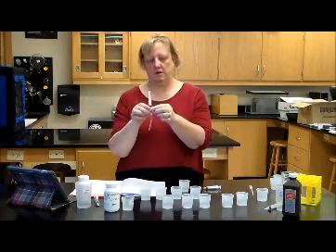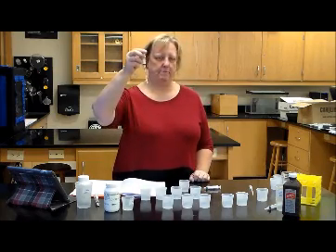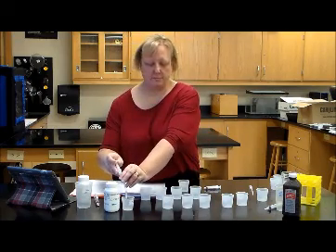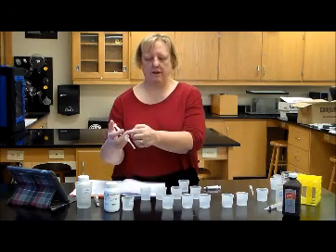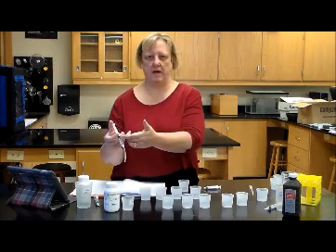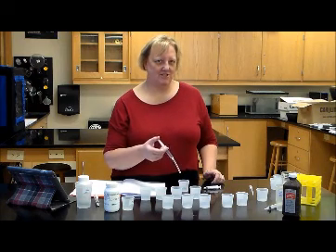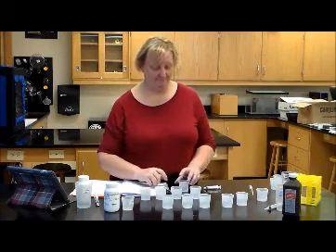Follow the directions. If you get all the way down to the bottom with your syringe and it still has not turned pink, go ahead and fill it back up with the potassium permanganate to a certain level. Mark down how much you're using so that you have a total of, for instance, 5 milliliters, and then you start dropping again. This is tedious. Just be aware of that fact.